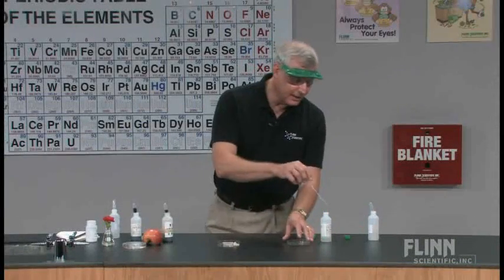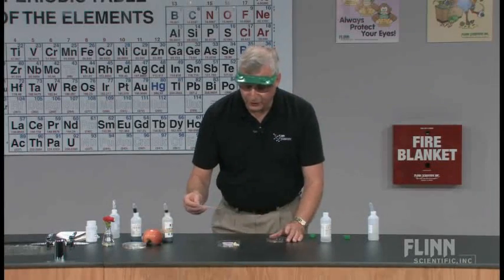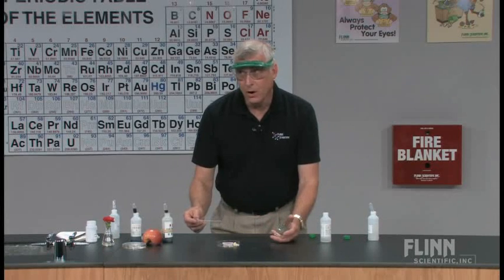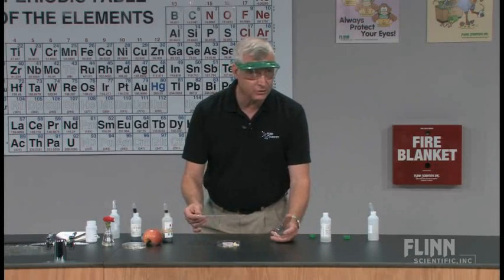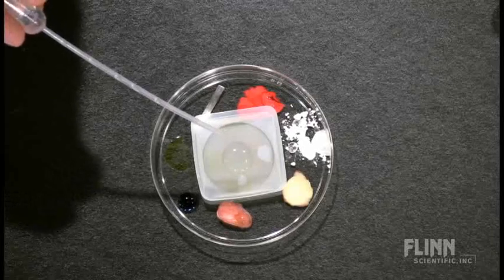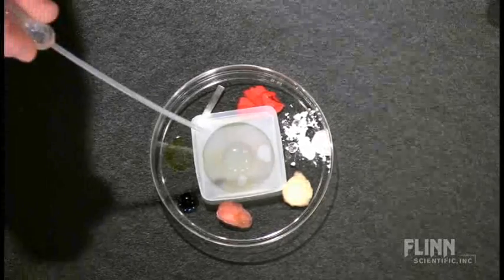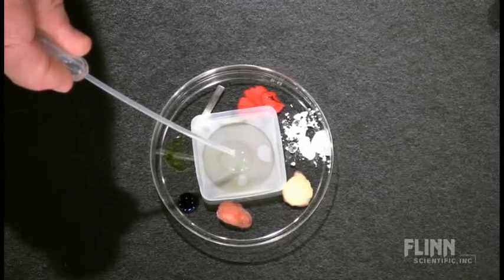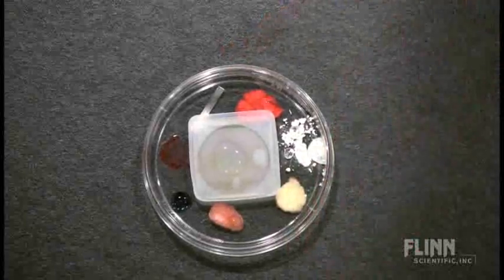To kick off the acid rain reaction, we're going to place some sulfuric acid in here, and then we'll quickly put the lid on top. We should begin to see some color changes with the indicators within the first few seconds, so we'll want to watch carefully for that. So we'll put about five drops of the sulfuric acid solution in, and then we'll put the top on to capture the change.